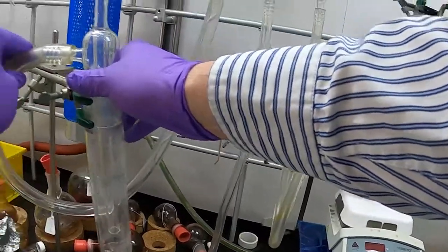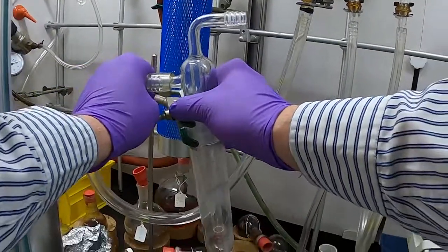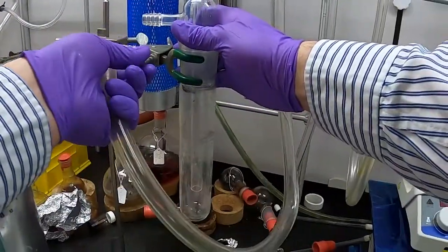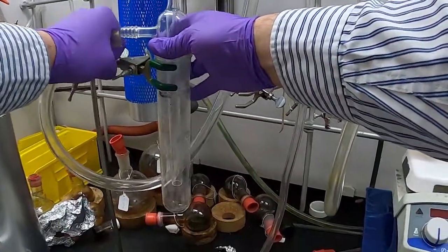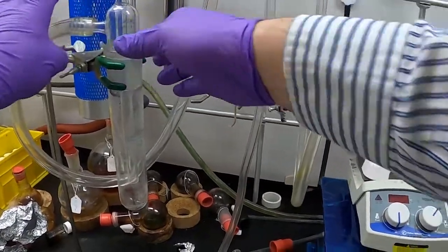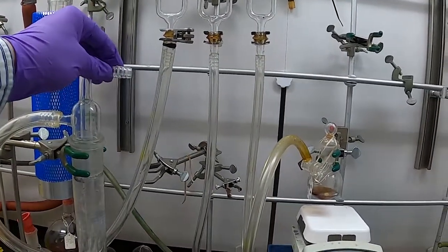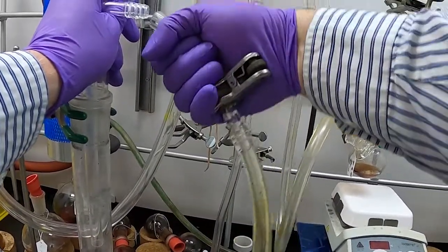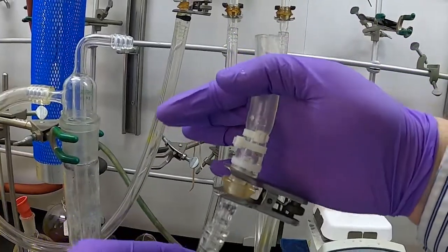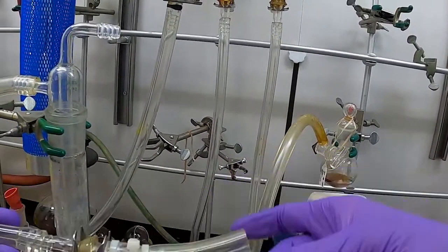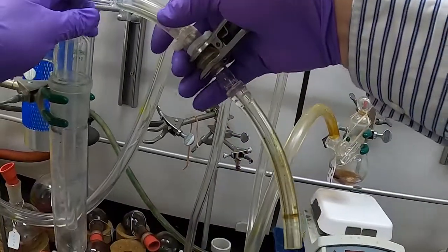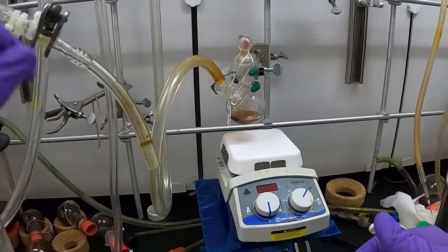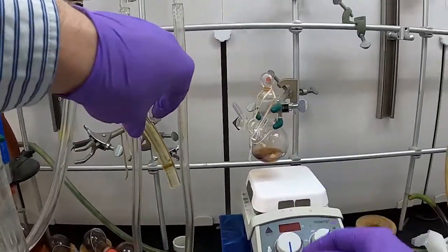We'll slide that on. Because we're going from a larger diameter tubing to a smaller one, we'll need to put an adapter. I have an adapter right here—a ball valve with smaller tubing here and larger tubing on the other side. Put the larger side over here and the smaller one on their side. We can simply pop this off because we're under nitrogen and then connect the other side on. Move our trap a little bit closer.